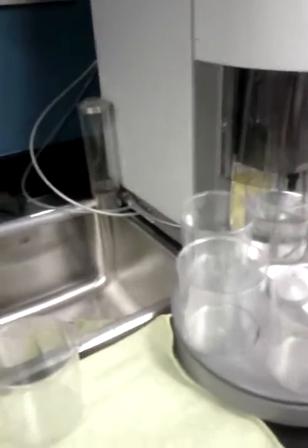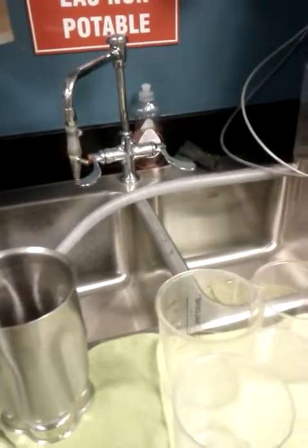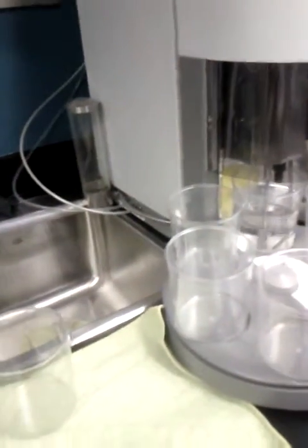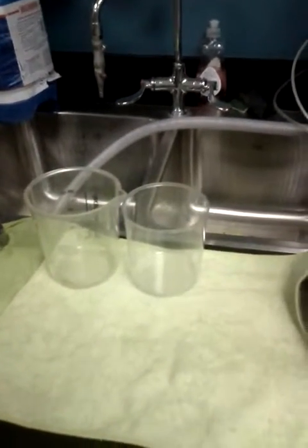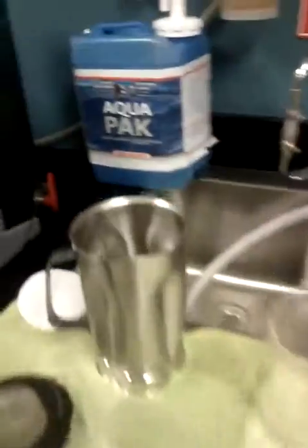Because as I said, yours is like a piece, but mine is very fine. It's smaller than mine. Okay. Maybe I should bring a little to try to see if it separates. You can also put a little bit with water and then you just stir like that. Or you can use this, but it's better to use that. You will avoid big pieces of agglomerated.